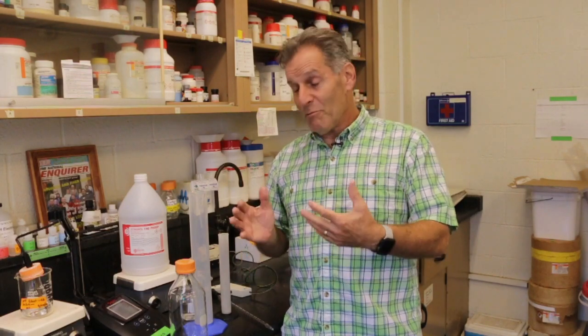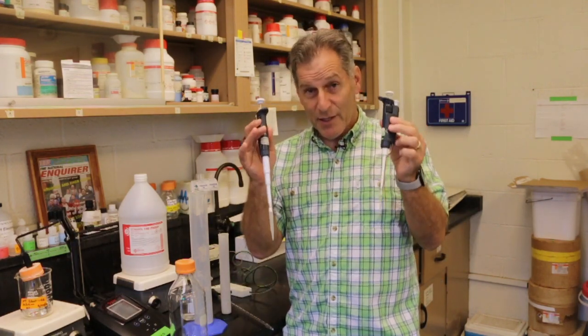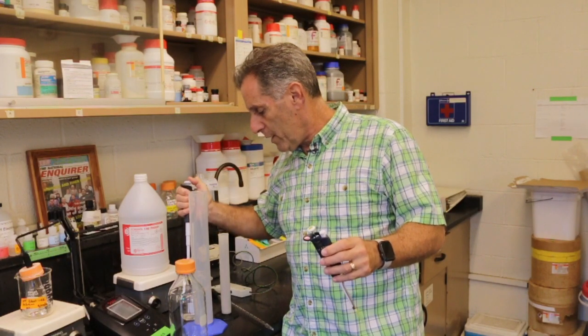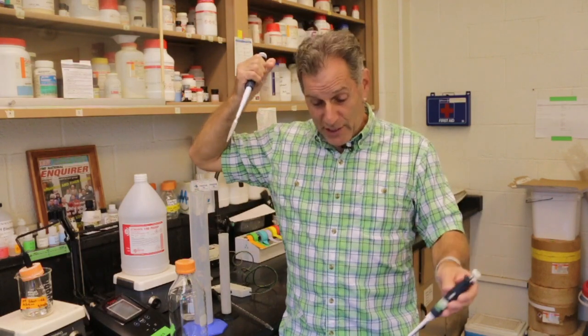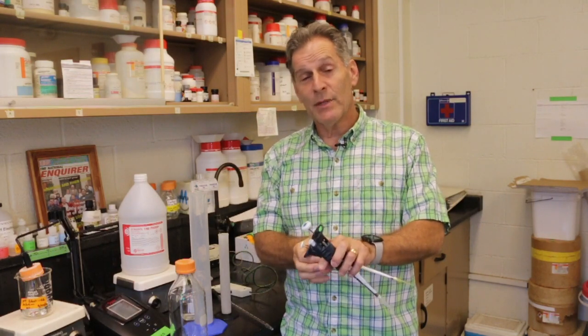It's really simple to measure in milliliters and in liters, and when you go below that, a thousandth of a milliliter is a microliter, and we've got nice tools for measuring really small volumes. So here we go. If this actually measures one mil, so this is a mil, and I just put 1 milliliter, which is a gram of water.